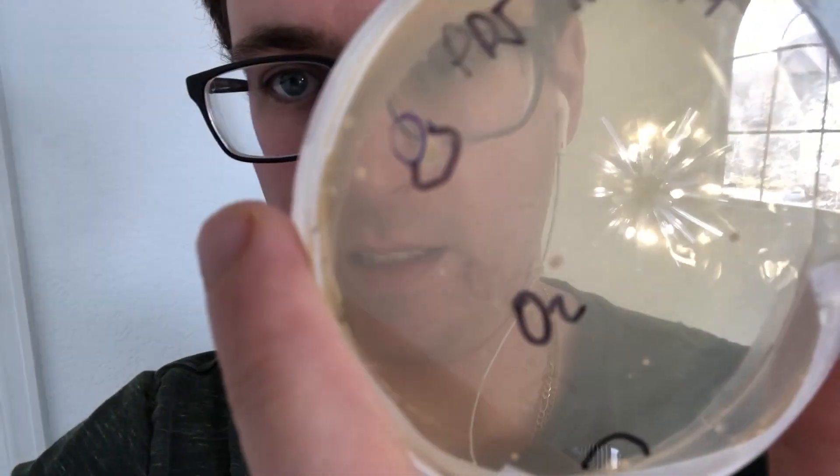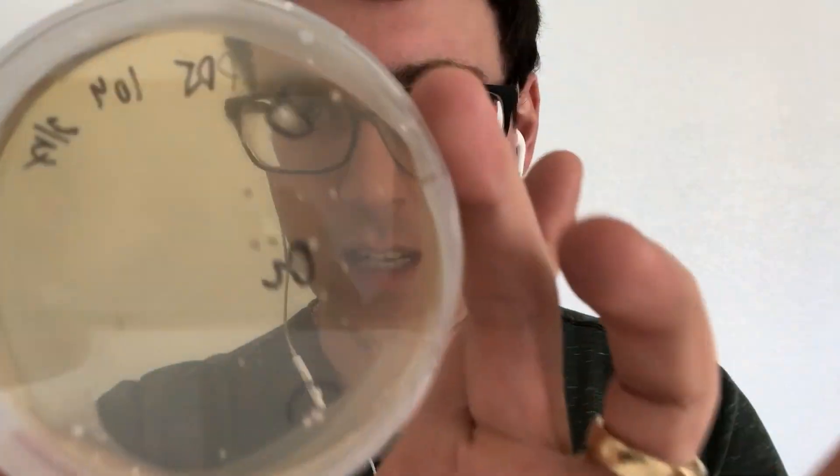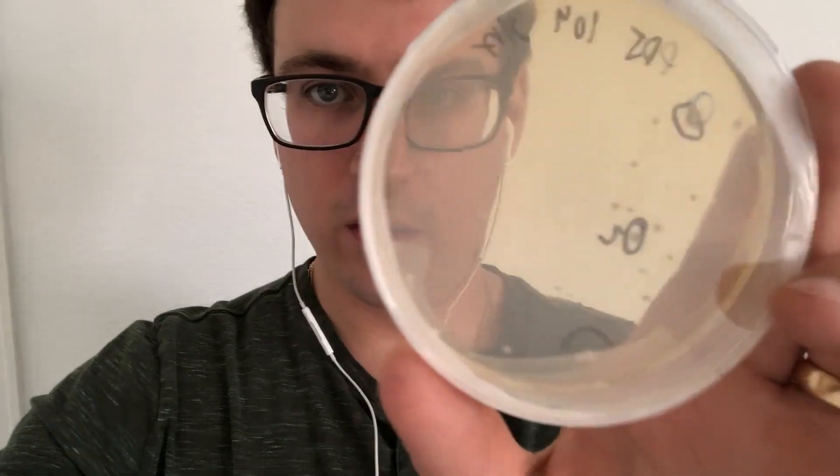Yesterday you can see that overnight there's about 14 or 15 colonies of this pink oyster. We're also starting to see a few chestnut colonies show up. They're pretty faint at this point, but I'm going to be keeping an eye on those.